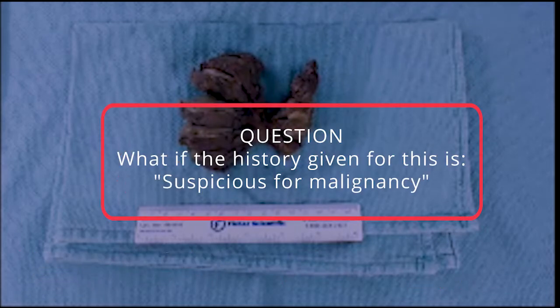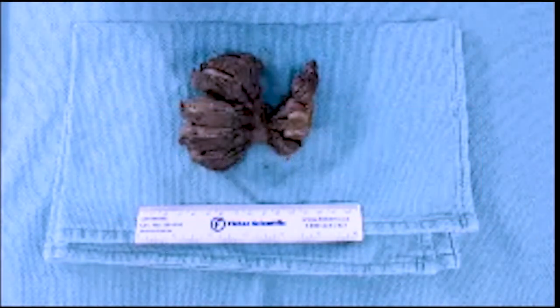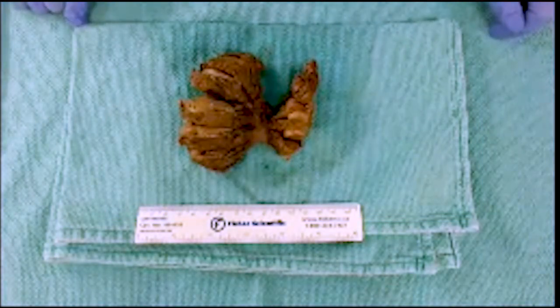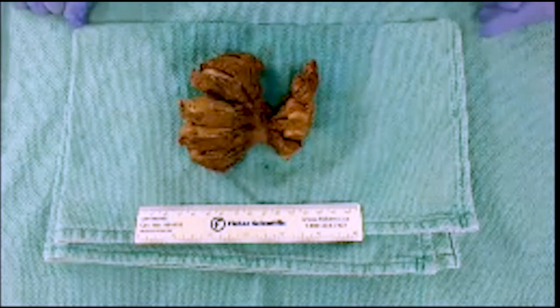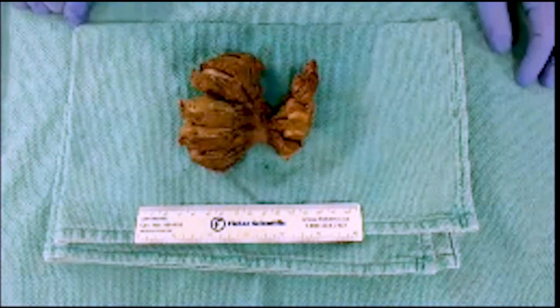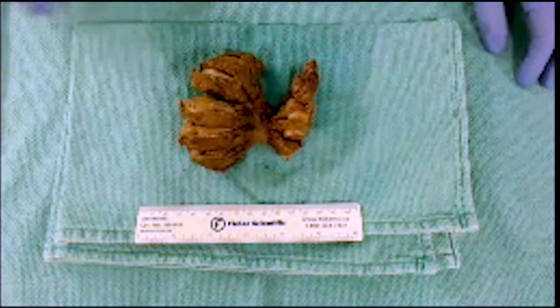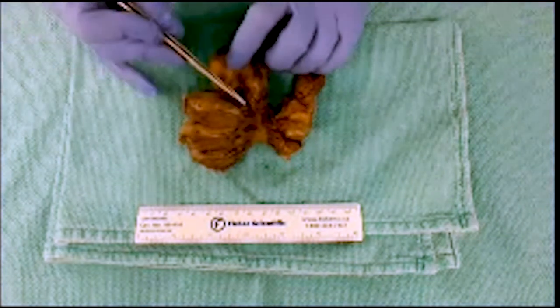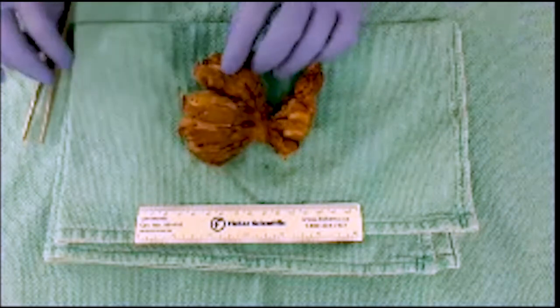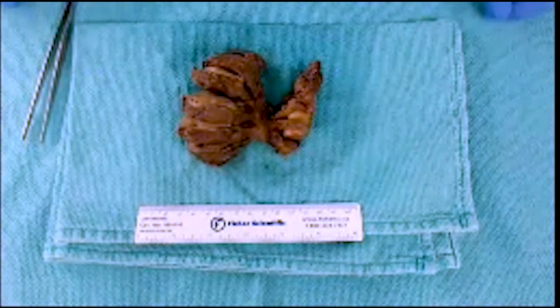Knowing that history, I would want to section at least one section per centimeter. I would also want to know which type of neoplasm we are dealing with, because that would shape how I submit this thyroid. For some lesions we are more concerned about capsular invasion, so that's when I would want to be sampling the capsule of the lesion in relationship to the normal parenchyma and thyroid capsule.